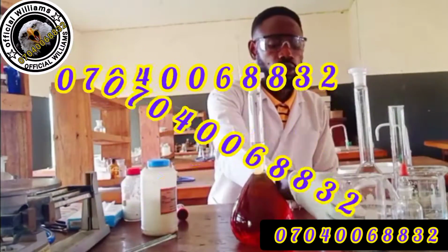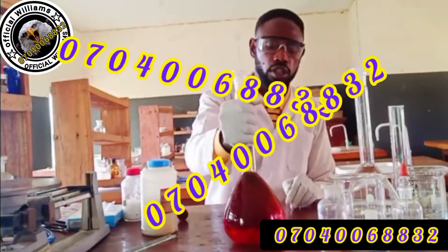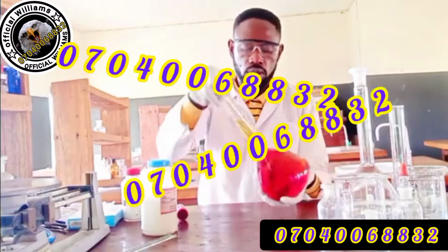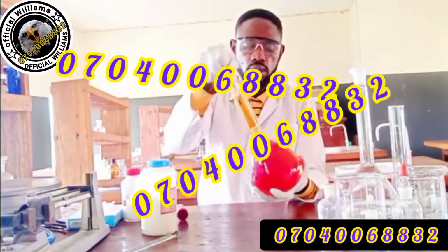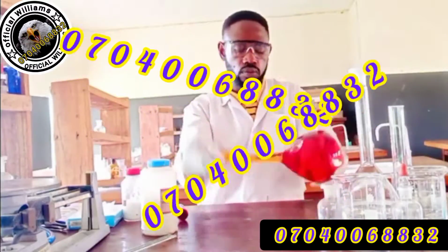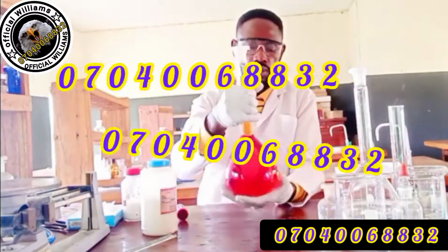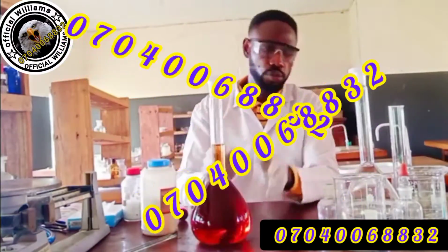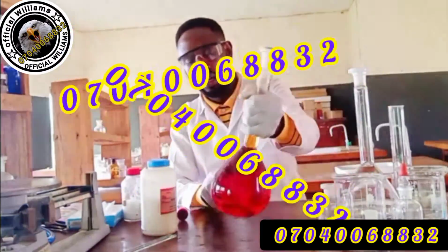Okay. So what I'll now do is to keep shaking. Next, this is my solution A already. The color is even enough to distinguish between the others because this is a reddish brown color.